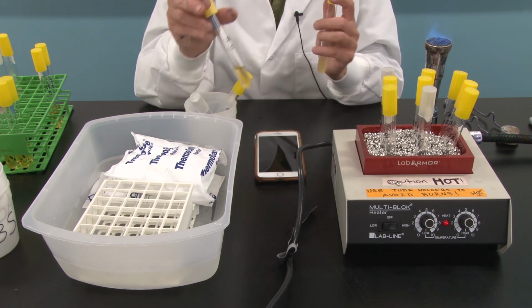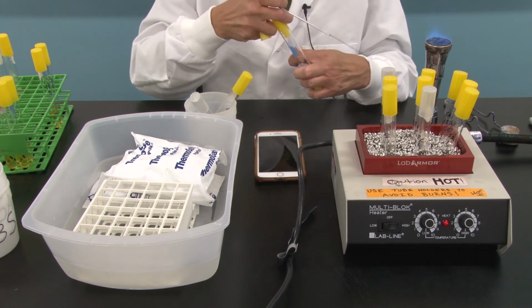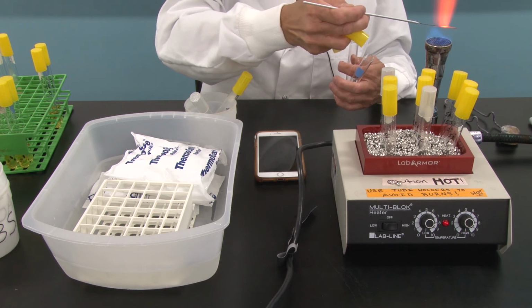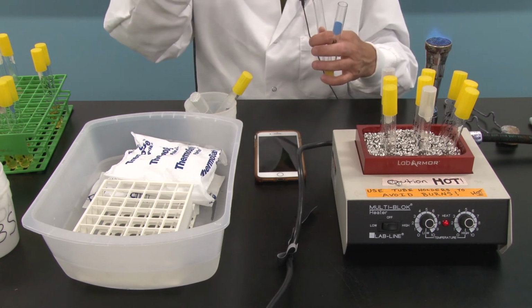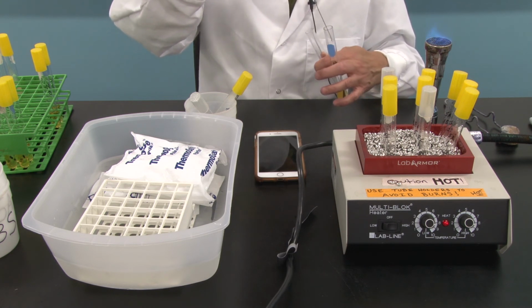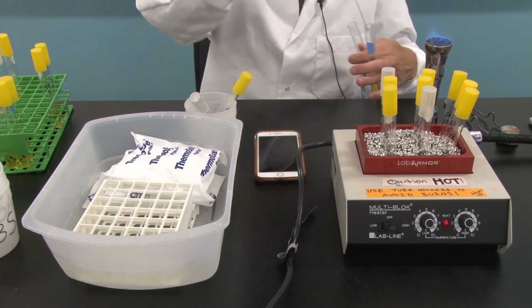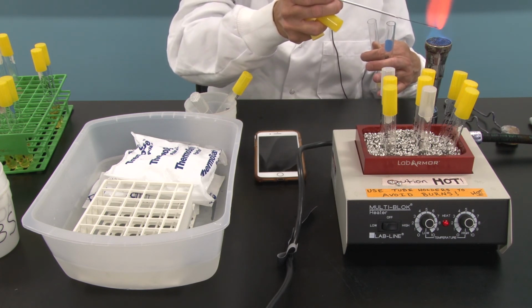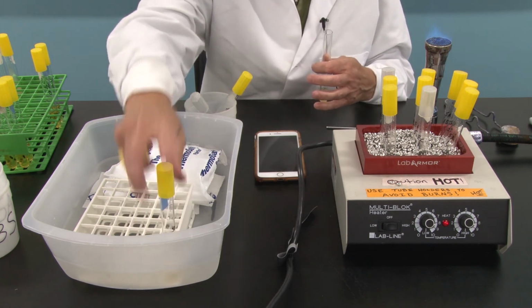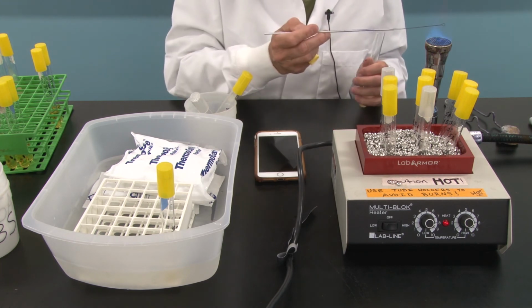This means it's never been boiled. And I'm actually going to use that as my control. So I want to make sure my stock grows in this medium, but I want to use a tube that has not been brought up to any boiling temperature. So I will inoculate that tube, which right now is at room temperature, but I'm going to place it on our ice bath as 0. And I'm going to do that for each of these as we go.